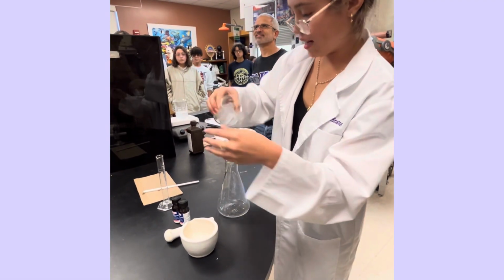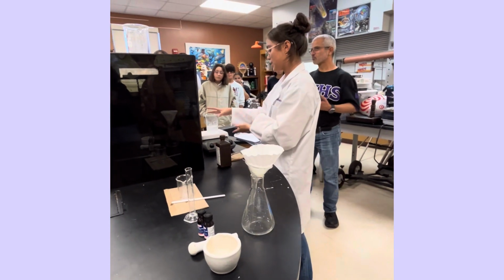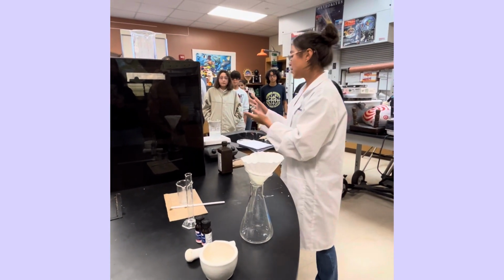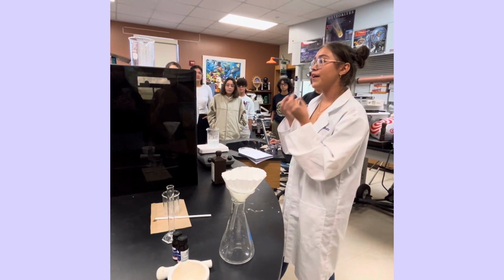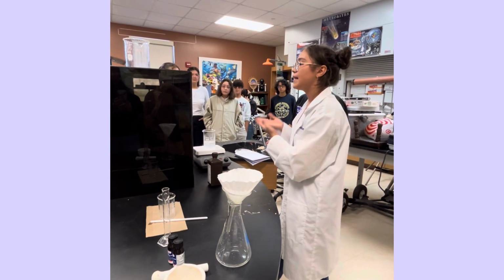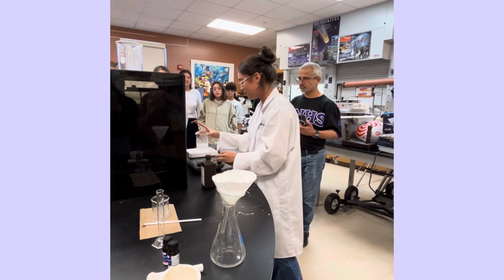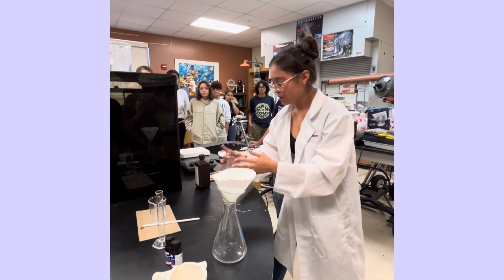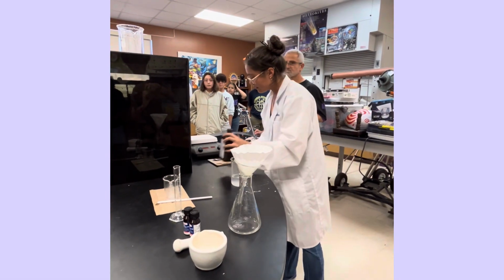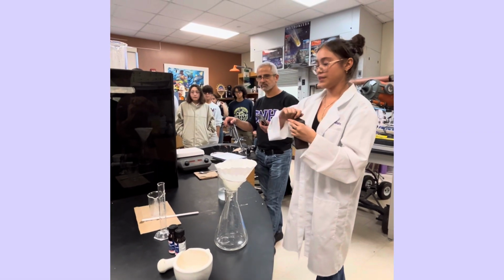And while that's happening, we're gonna work on our second solution, which is cornstarch, which I already prepared. So cornstarch, we're gonna dissolve in distilled water, but it's very hard to dissolve. So we're gonna heat it up to be able to get as much cornstarch dissolved, which I already did here. And now that we have the cornstarch, we're gonna add 75 milliliters of hydrogen peroxide to the cornstarch to make our second solution, right?